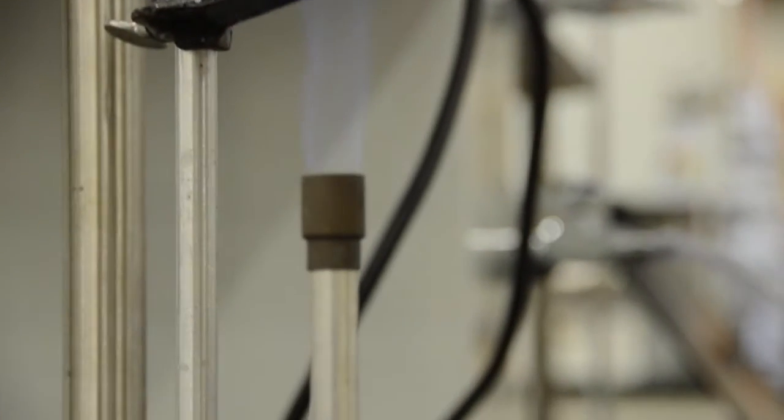Welcome to the Bunsen burner safety video. In this video we will make sure that you learn how to use one of the more dangerous pieces of equipment in the lab properly and safely.